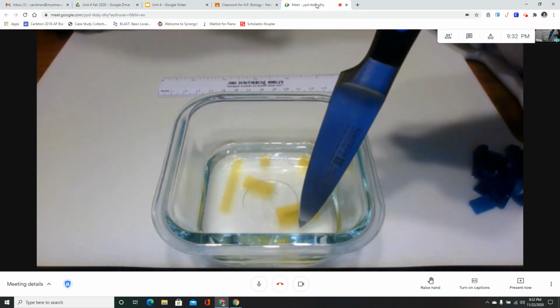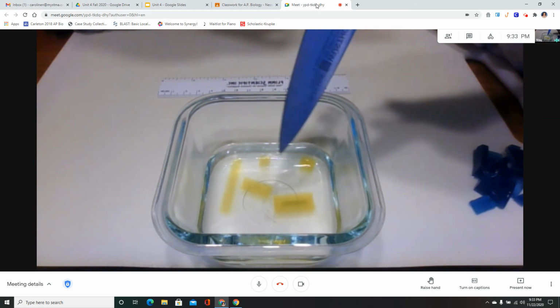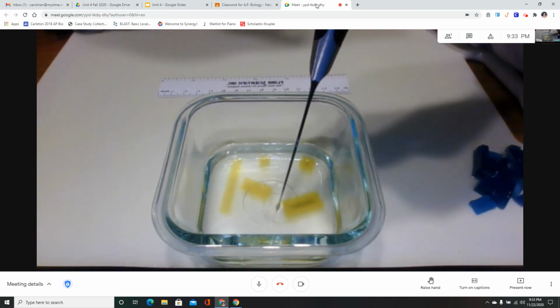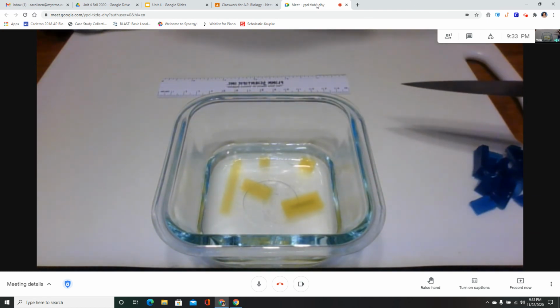The only one we're still waiting on is the large rectangle. This guy right here still has a streak of blue through the middle. It's getting pretty faint. I know it's hard to see in the video. So I will tell you when that one is finished. It'll be not too much longer.